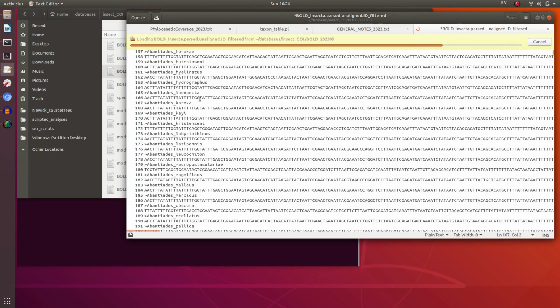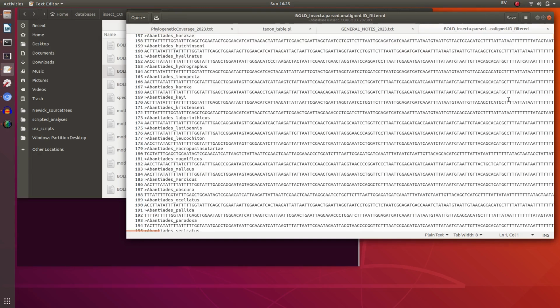and compare this sequence. Just treat it as a query, just ignore what's on the label, and do molecular identification of a sequence against a similar COI insect data set and see what name it gives, and see if the name broadly matches the name given by the submitters.